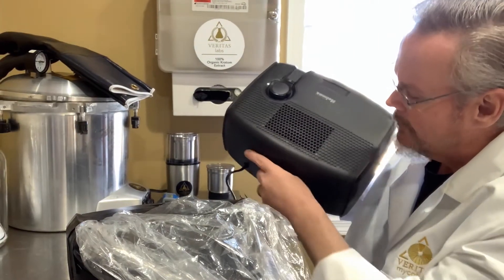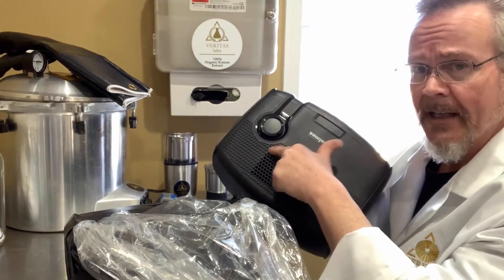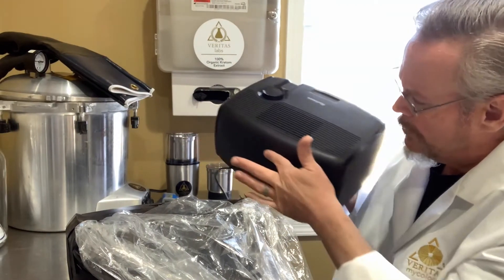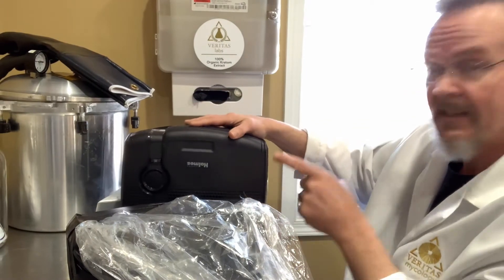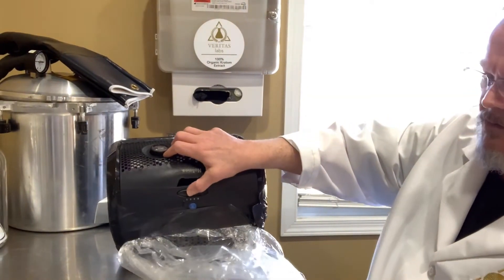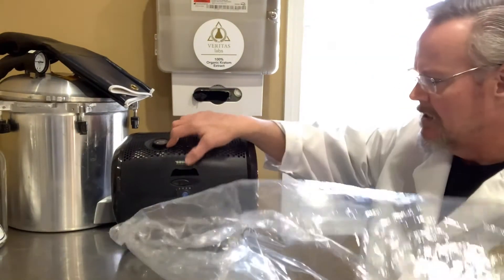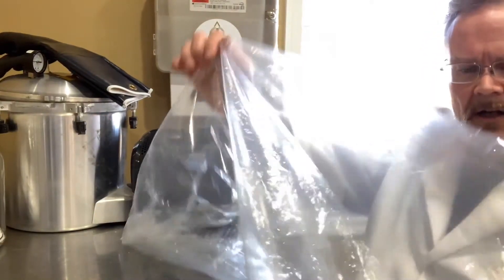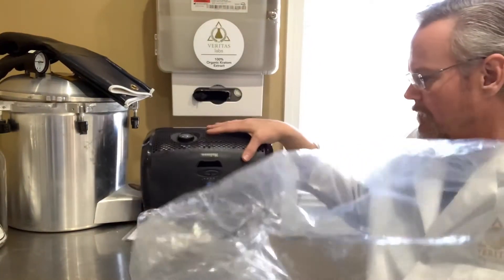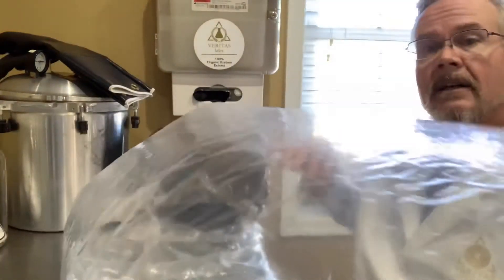The only opening is here. So if you get your bag around in this area on these new units, you'll want to go around your control knob, but you can do that very easily by just taping your bag down, going over and around, taping it down. Then you'll set your unit on its side to facilitate the expansion of the bag. I'll show you right now with the older model — the one we did before — and you'll see the unit begins to expand. It's got its holes already in it, so it will take a moment to fill up. And there she blows — that's it, guys.